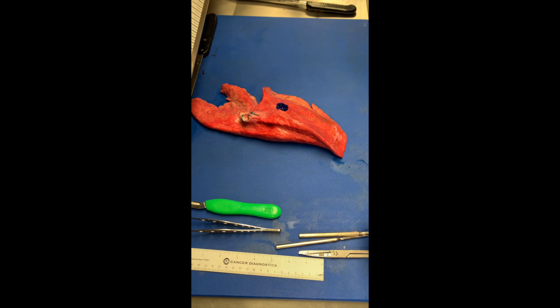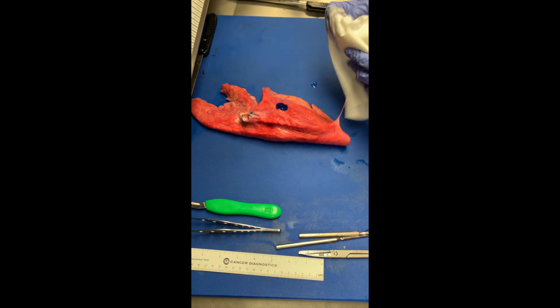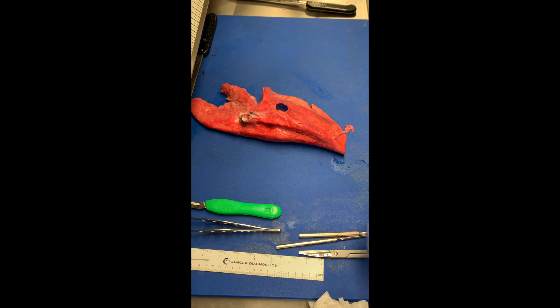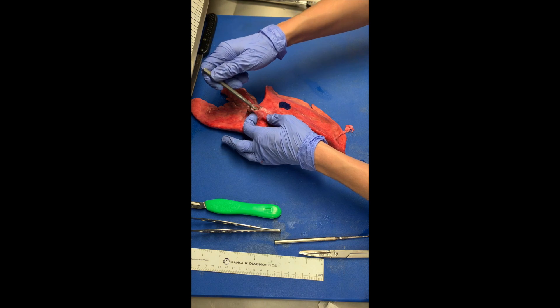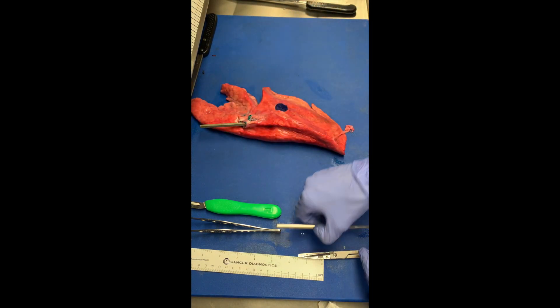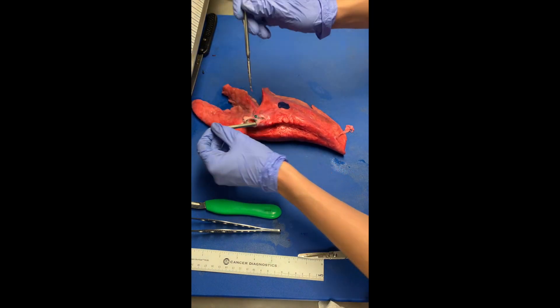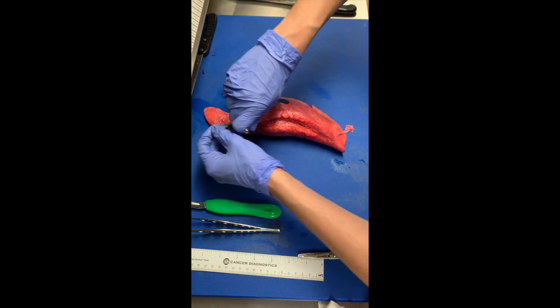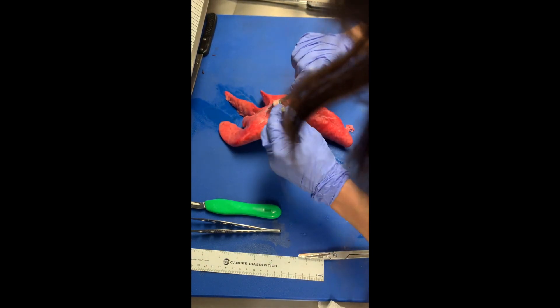After you have allowed your ink to dry and applied a little mordant, go ahead and find two probes and place them in the airway. I suggest doing the airway approach on your left lung because it is less lobulated than the right. You'll notice that the secondary bronchi dives down pretty quickly here.